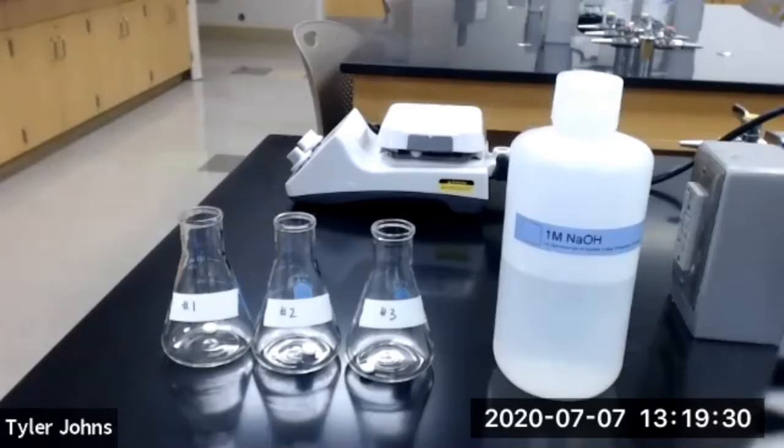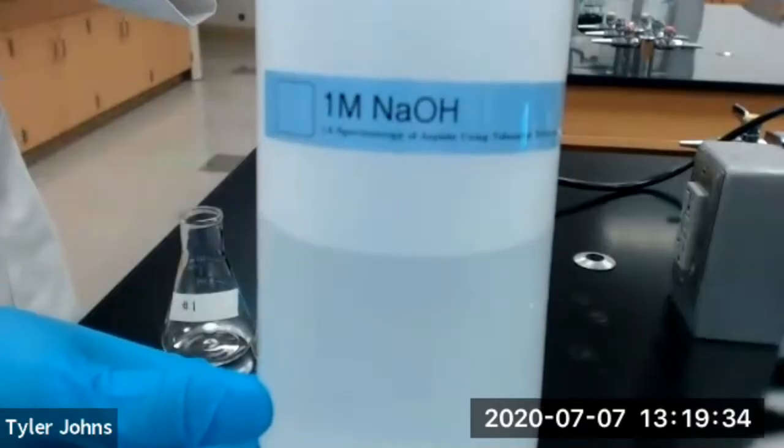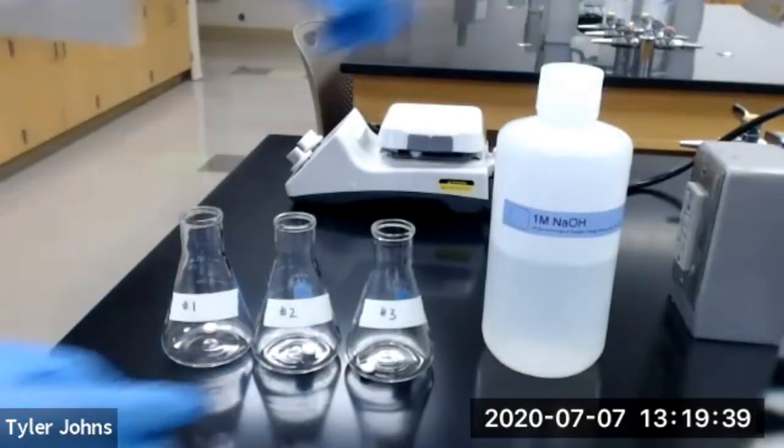We now need to add 10 milliliters of our 1 molar sodium hydroxide solution to each of our 3 Erlenmeyer flasks.